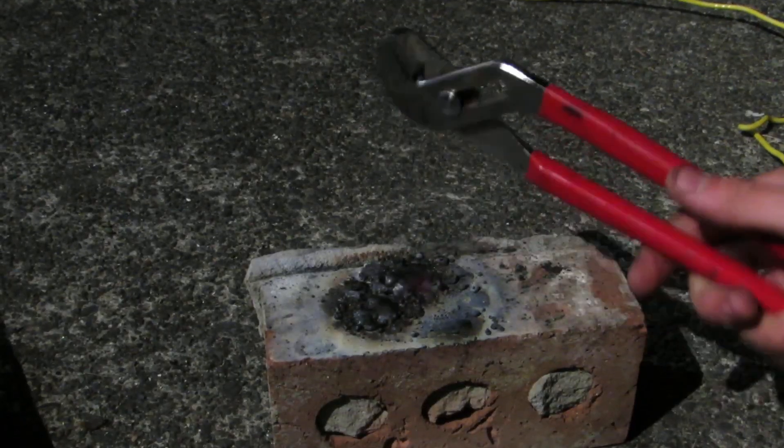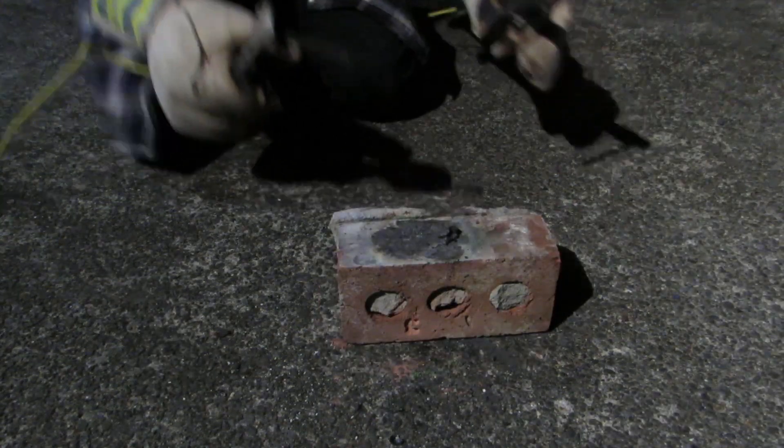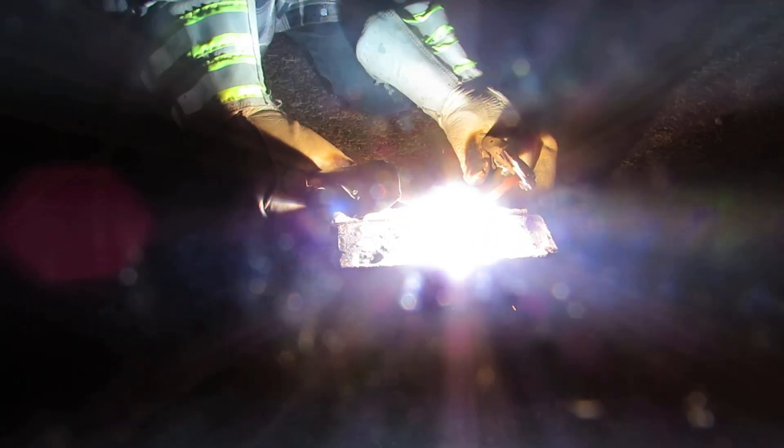The slag was broken apart and any pieces of chromium metal were recovered. The chromium beads were then placed in a pile and melted together into one chromium block.